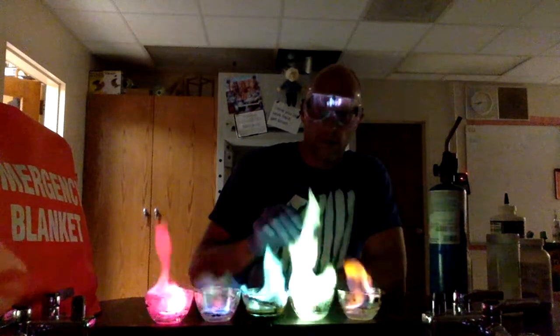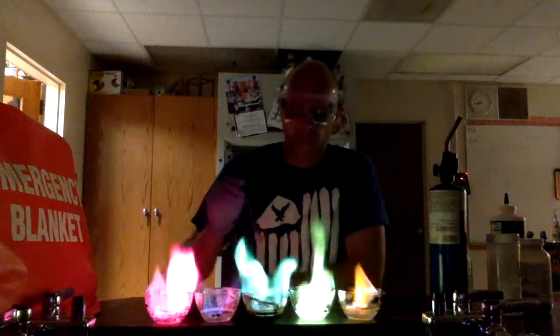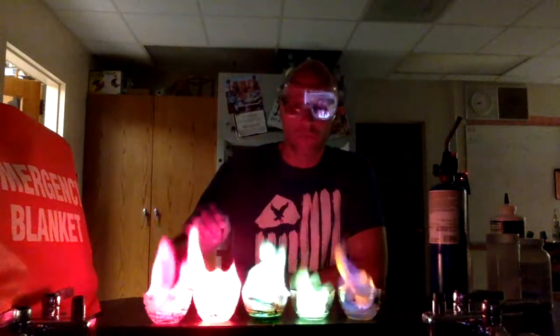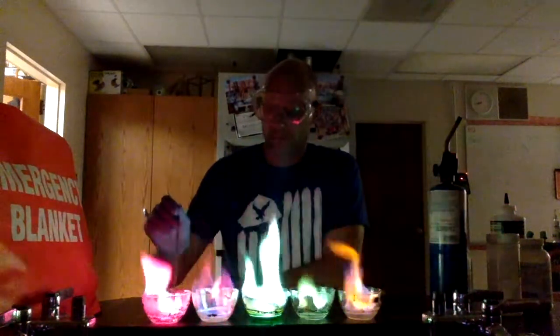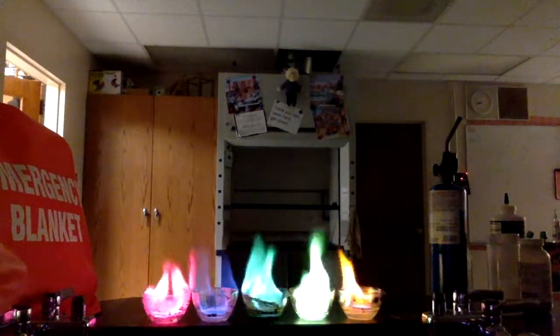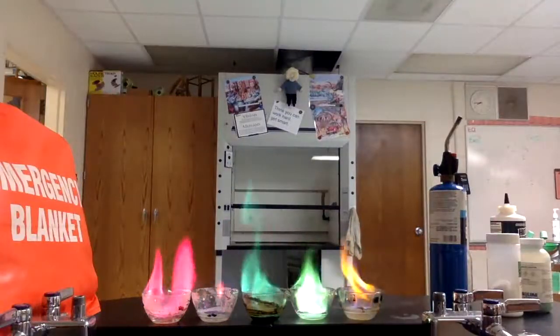There's our boron. There's our boron. And lithium. So we actually call this a flame test.